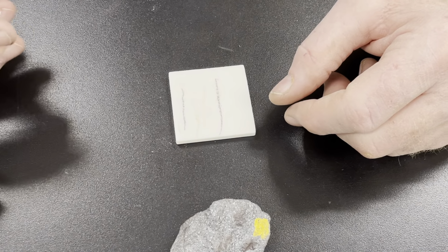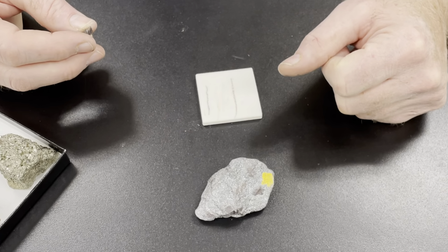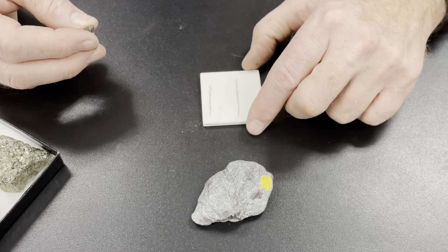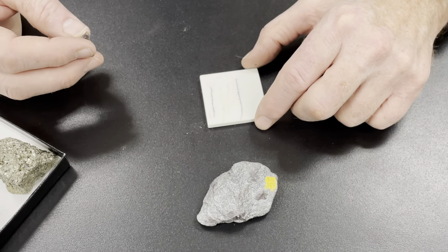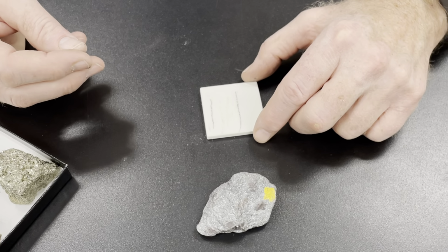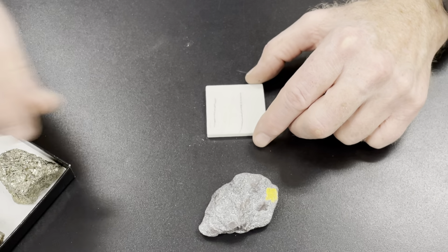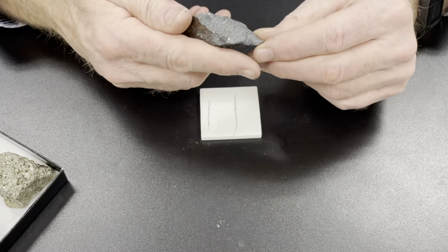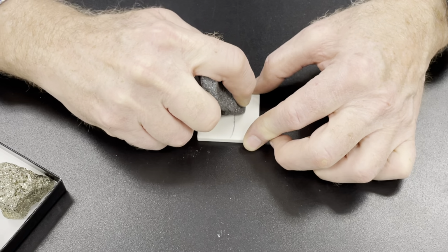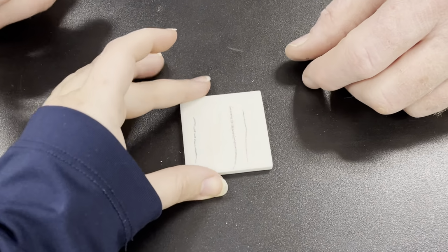This is hematite, and hematite has a red color when it's a fine powder. So you really see this reddish brown streak, usually kind of brown. Other iron oxides, hydroxides, can be orange and a little brighter in color, but this one gives us this reddish brown streak. Let's try this one. This one should be hematite as well. Fingers crossed. But who knows? So again, we're seeing this reddish brown streak.